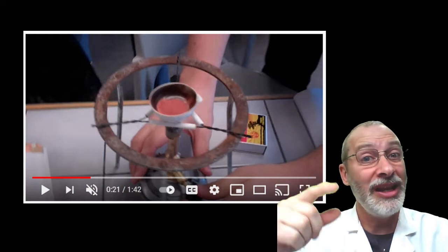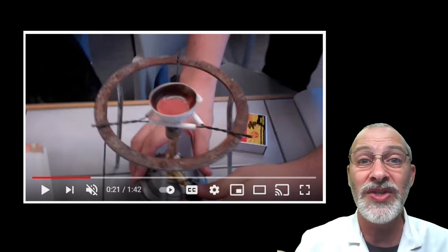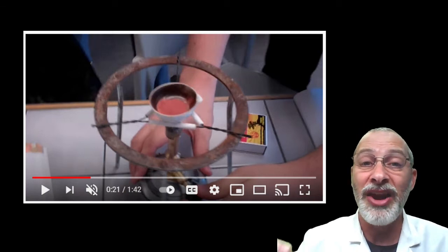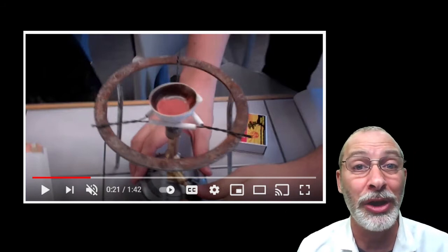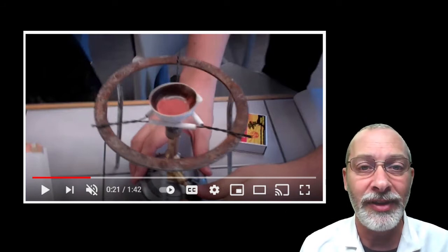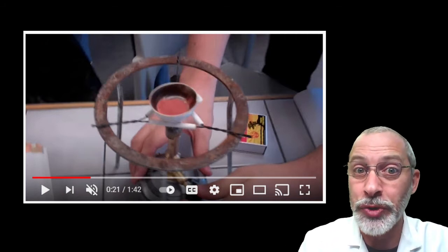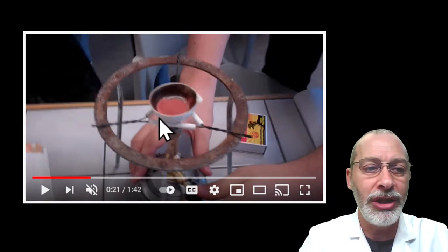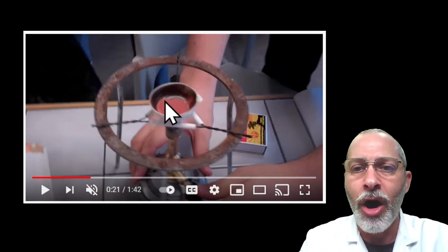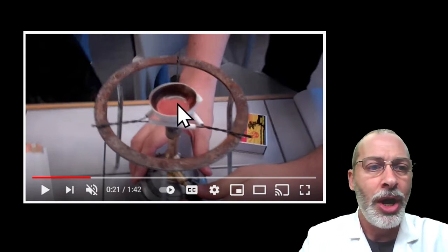But if you can list for me at the end of this assignment and submit me some of the things that are wrong, and think about previous topics when we learned about lab safety, think about what lab safety issues might exist in this particular lab. But what I do really want you to focus on are the contents of this dish.